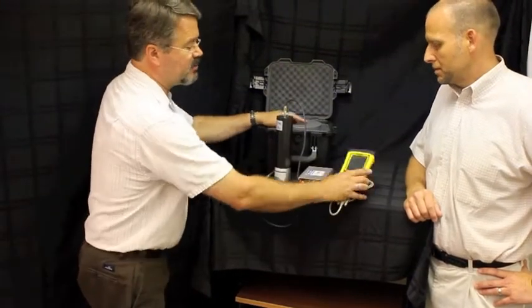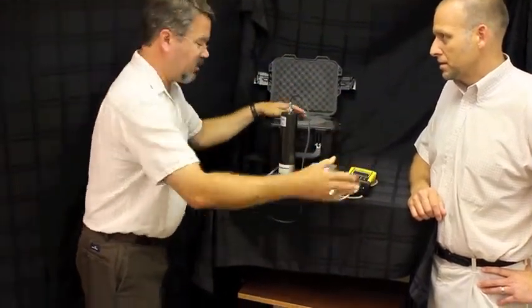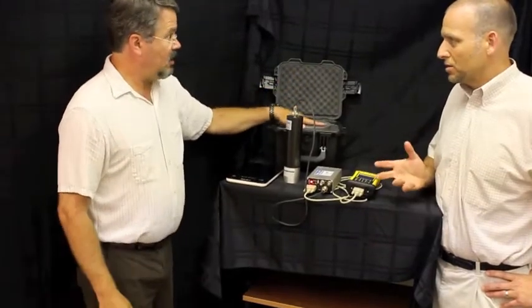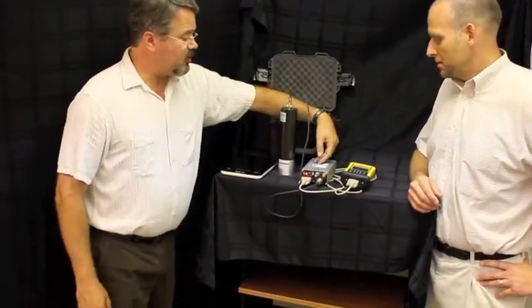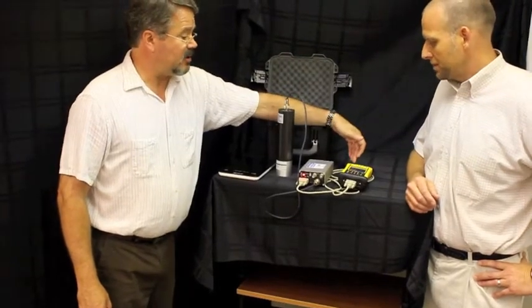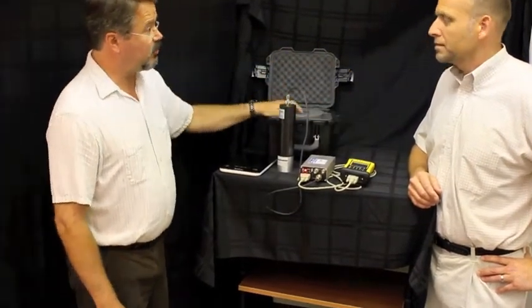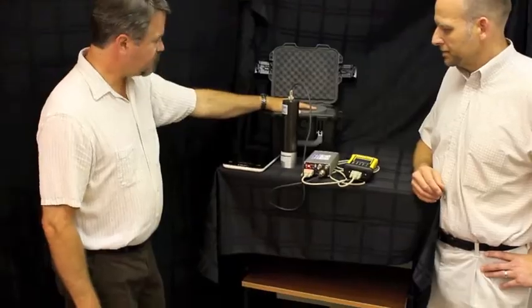Yes, in the laboratory you would probably just go ahead and plug in via AC power into the wall. Can you use a vehicle adapter as well to power these devices? As long as you can provide 12 volts and I believe 24 volts power for mobile.